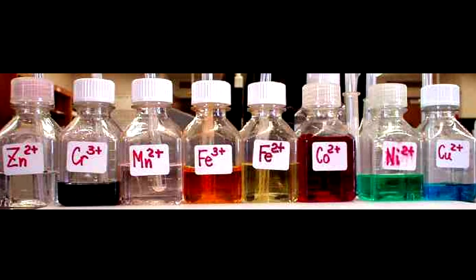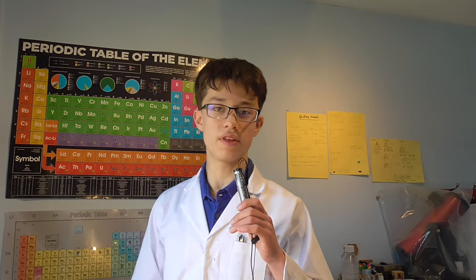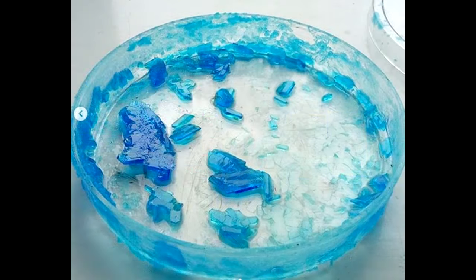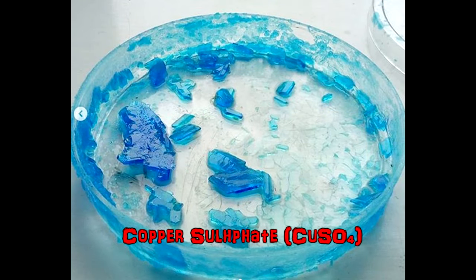A lot of the transition metals have a specific characteristic, and that is their salts tend to be very brightly coloured. Another example of this is copper. Any salt containing copper ions tends to be quite blue, unless it is copper chloride, which is blue, but in a high concentration of chloride ions it becomes sort of green.